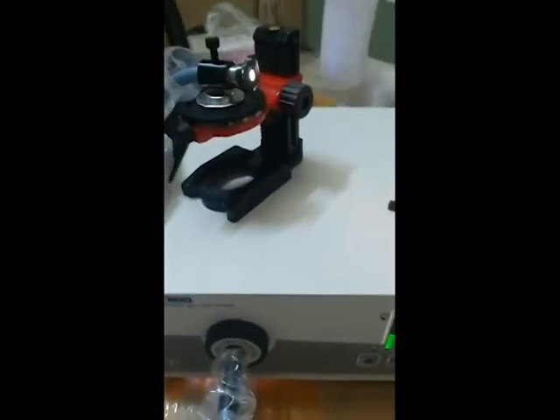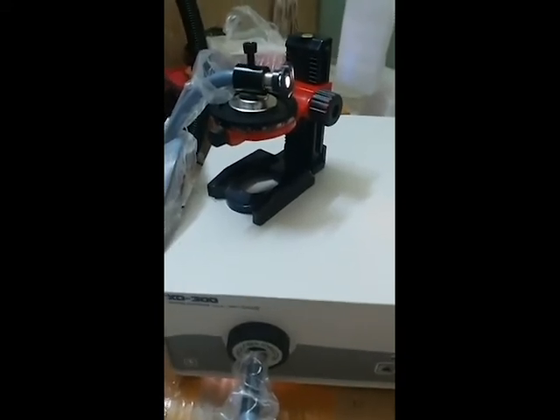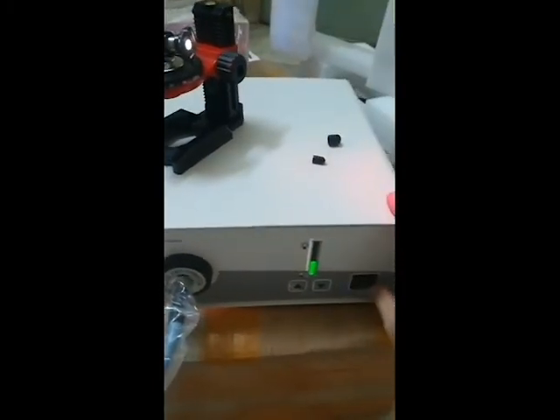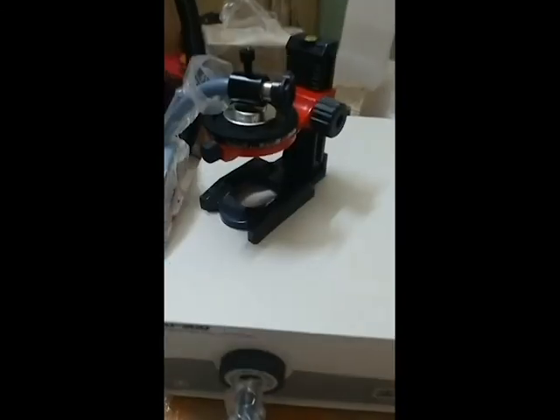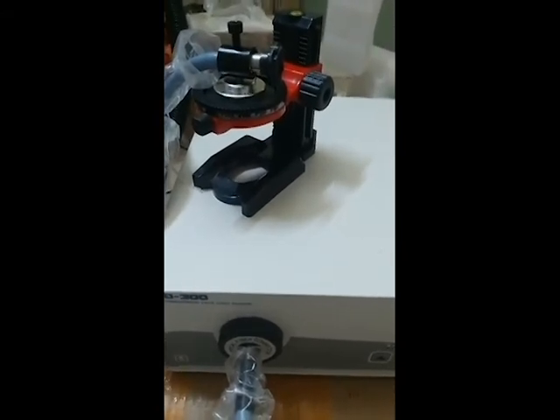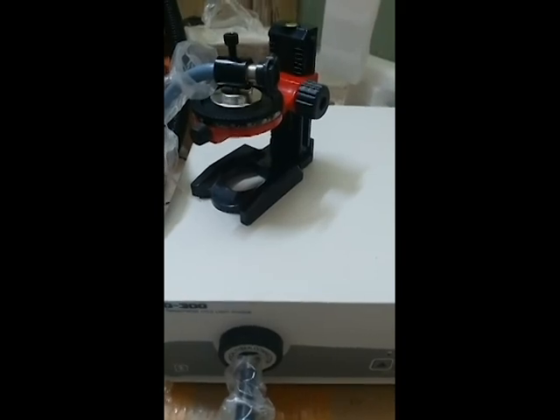After finishing the installation and your experiment, you can turn off the light when done. Simply switch off the power supply, then wait for the next use. Please keep the instrument clean and dry, and store it in a safe place.